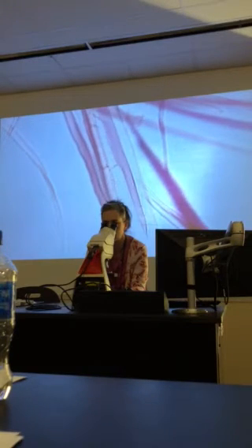With the pits. Let's see. Let me see if I can find some better ones I like. Oh yeah, much better right here. So the ones that tend to have more of the wider structure and the cross hatches, okay, these are my vessel elements. Okay, I'm trying to find a little bit better. Some of them aren't very dark. Oh, right there. Those are some really good vessel elements right there.